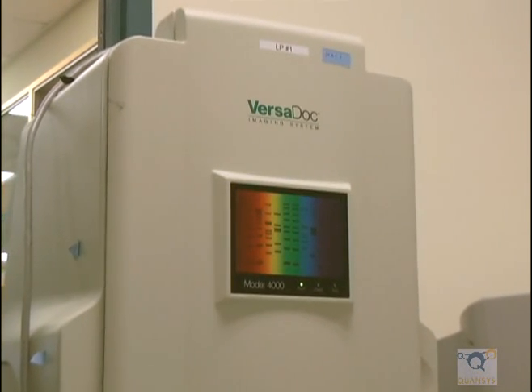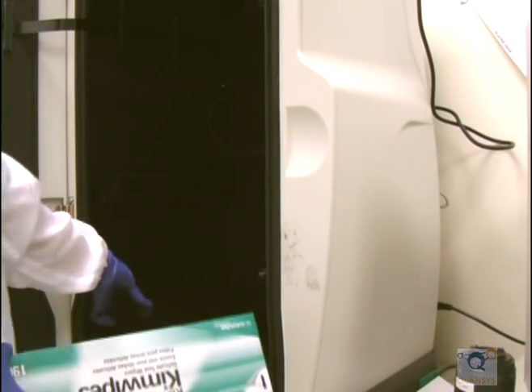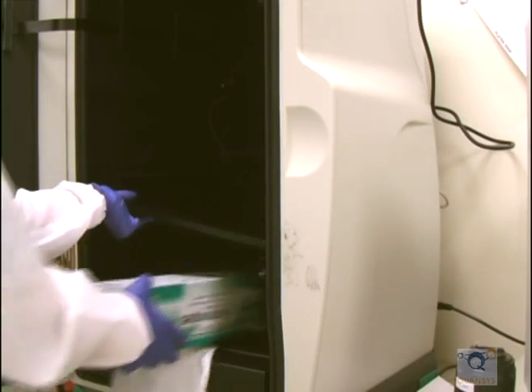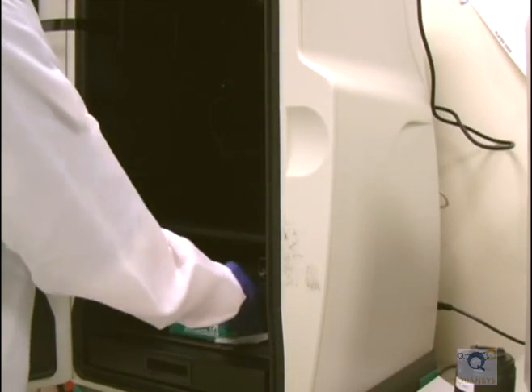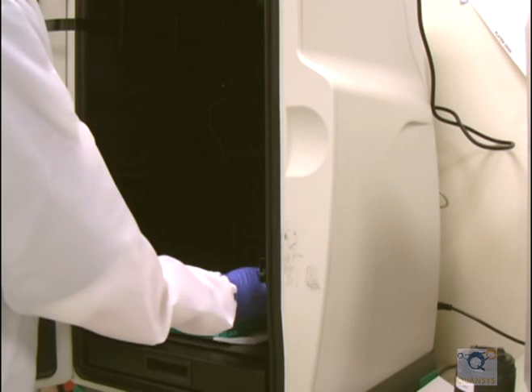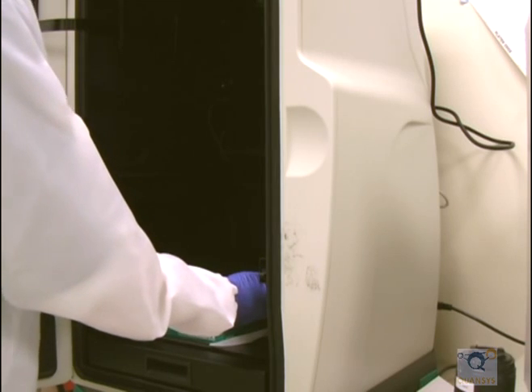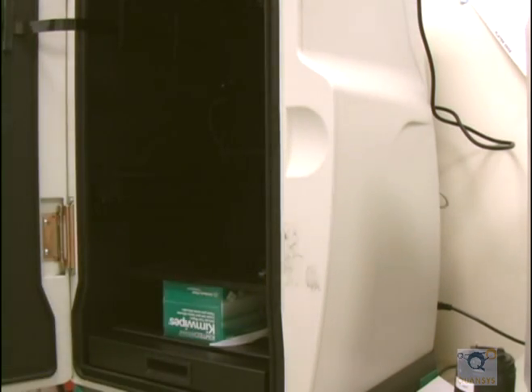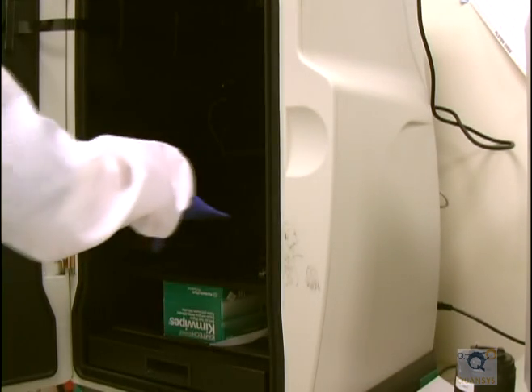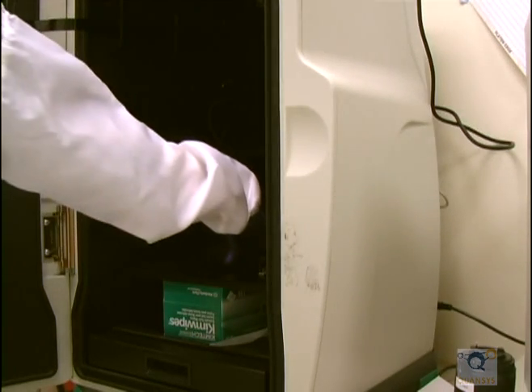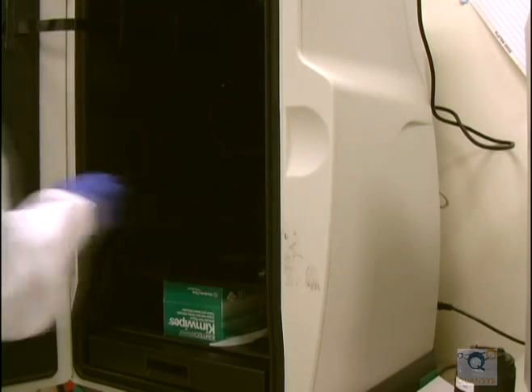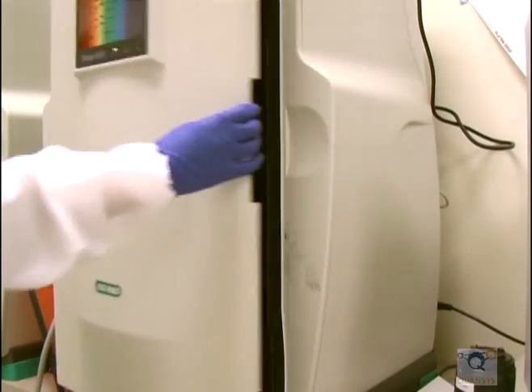Camera Setup and Focus: Open the imager door and place a box or stand in the cabinet below the camera to increase the imaging height between 4 and 6 inches. Place the imaging target sheet or mouse pad in the cabinet on top of the box or stand.